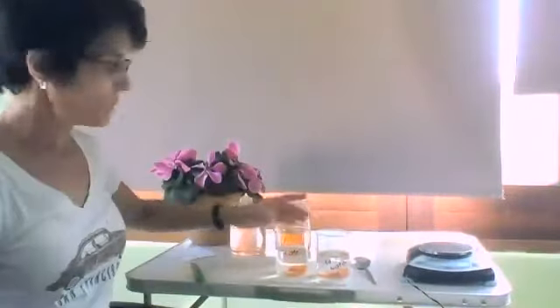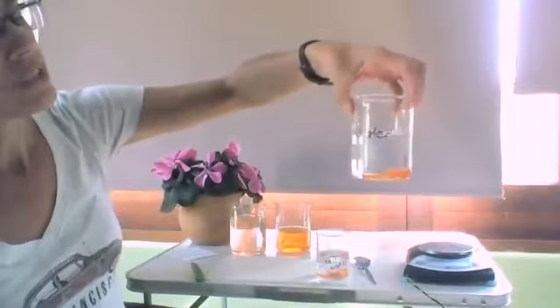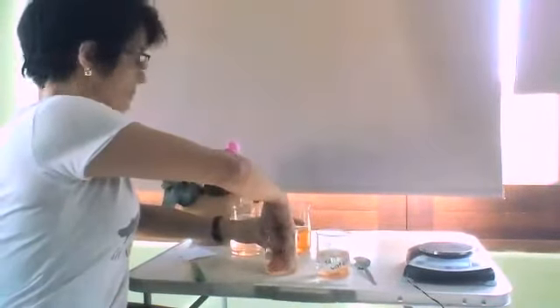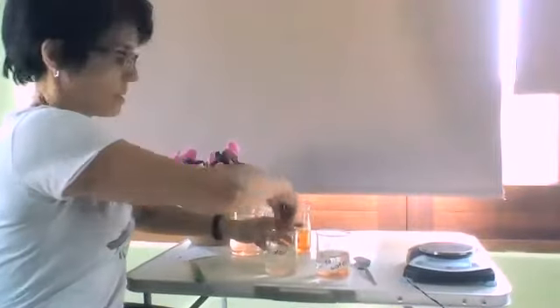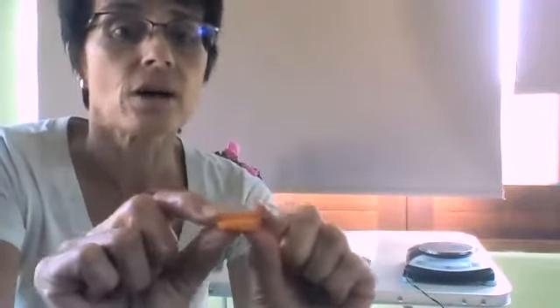The next experiment — so here, the carrot disc was placed in water. I'm going to take it out. Just dry them off a little bit. Right now they are really, really hard.